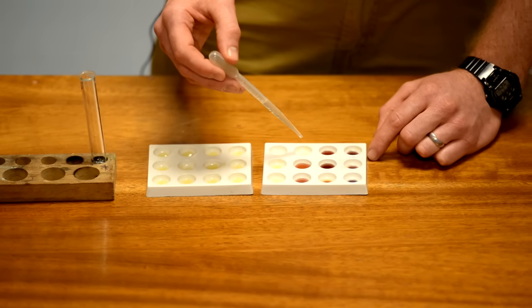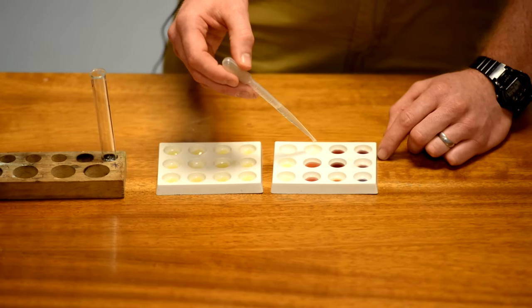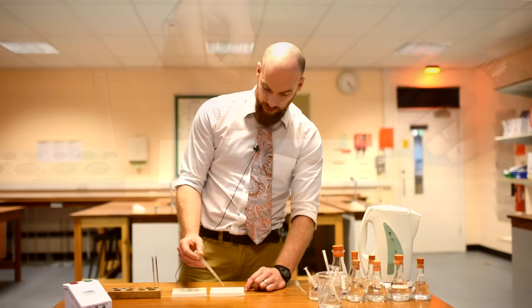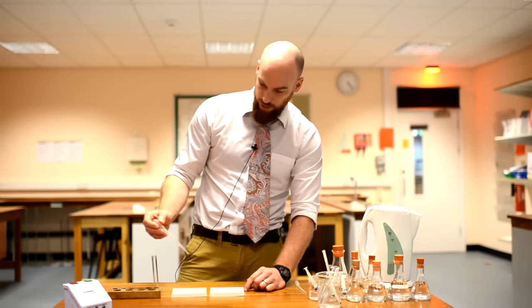You might not want to be too generous with the amount of solution you're putting in because if the test drags on you would run out of solution.